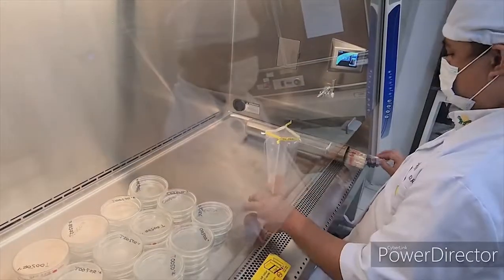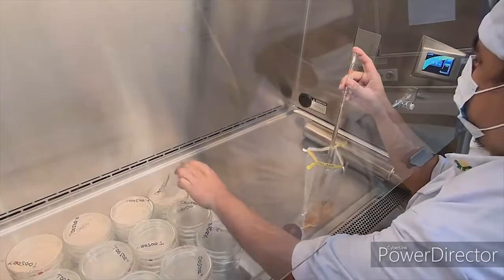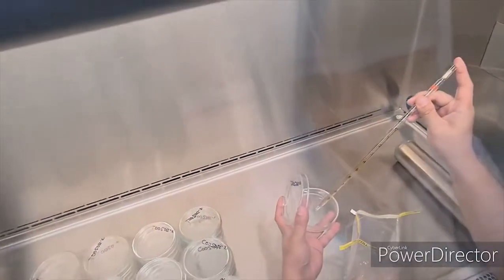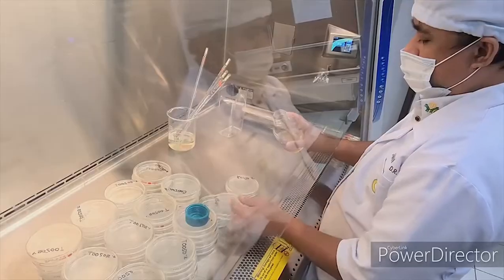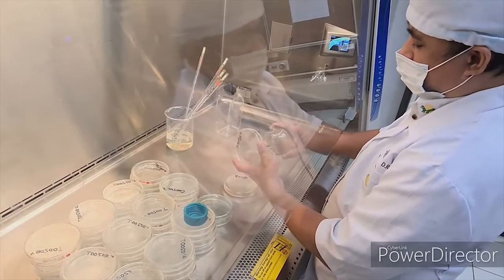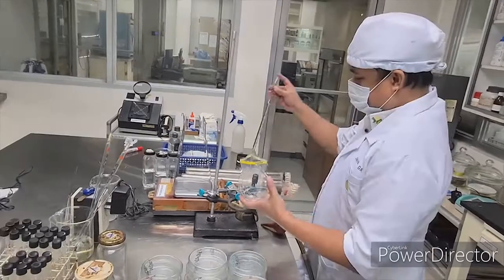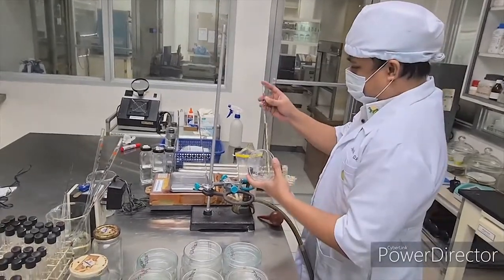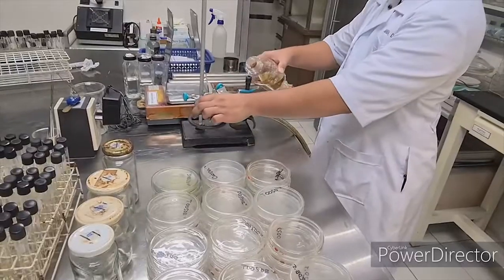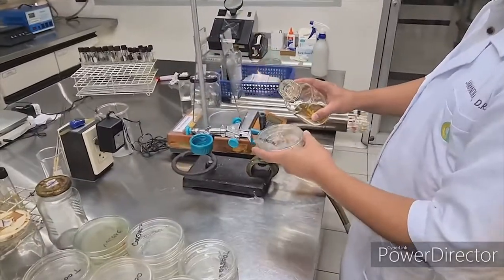The diluted sample is dispensed in the plates and tubes. Tempered agar is then poured into the plates with the sample. It is swirled and allowed to set. Alternatively, for sample dispensing and agar plating, the conventional method using open flame may be used.